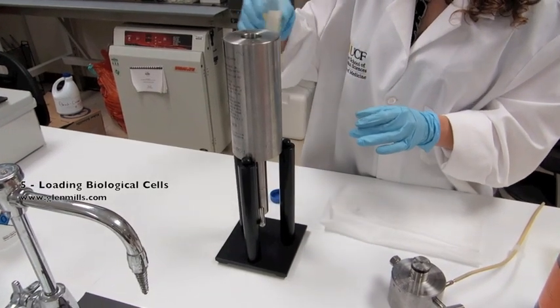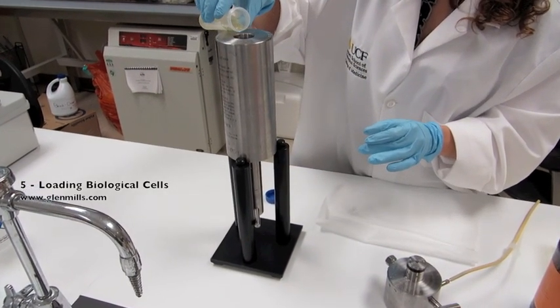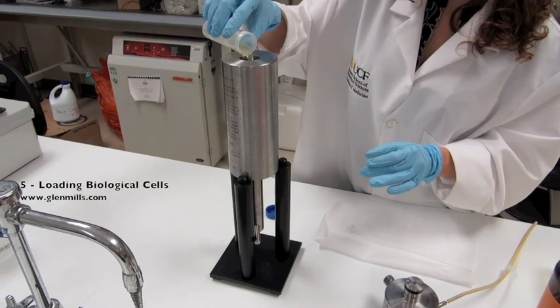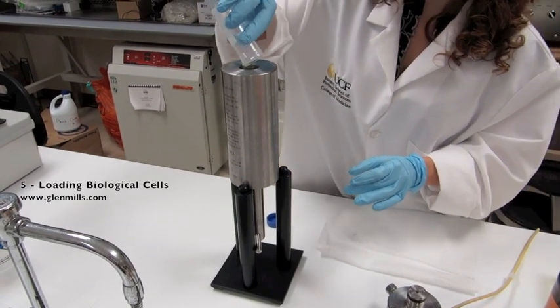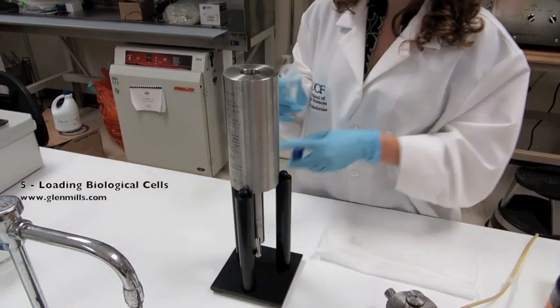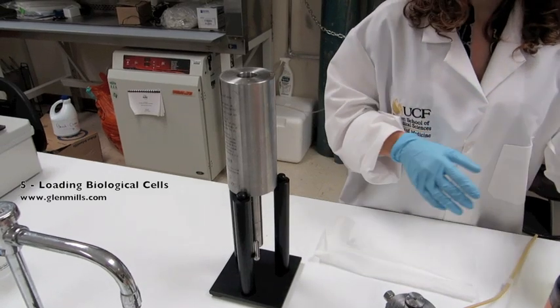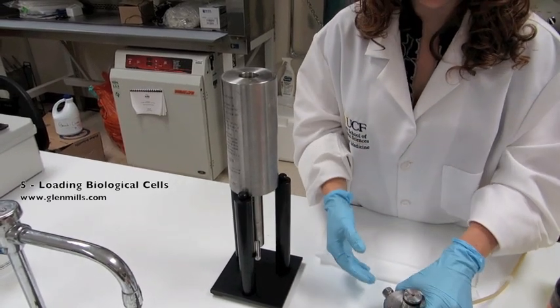If users have less than 35 milliliters, that is okay. If greater than 35 milliliters, run multiple passes through the machine. If being used for protein purification, keep samples on ice and the cell in the fridge when not in use.